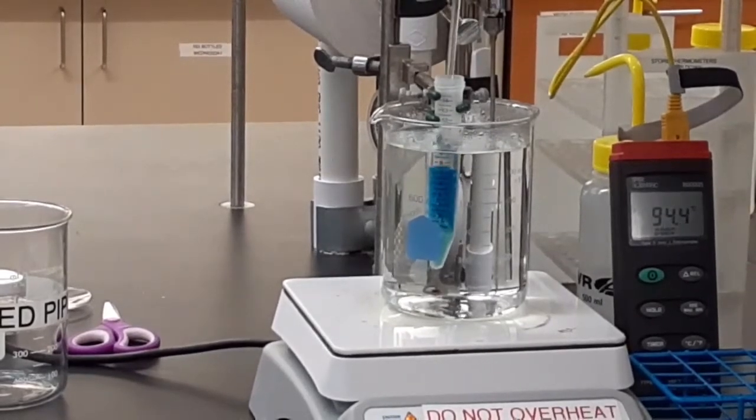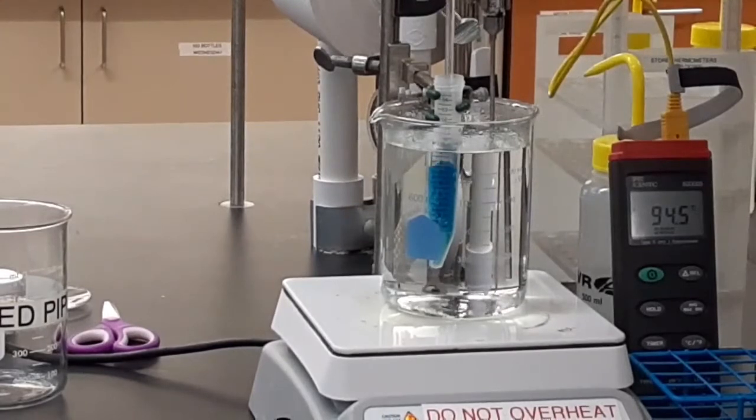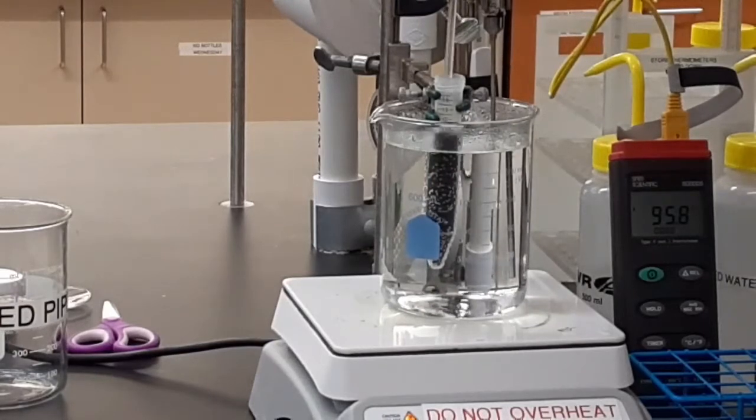Now, you're going to have a thermometer. It won't be quite like this thermometer, but you will have a way to watch the temperature. Your temperature needs to be in the mid to upper 90 degree range, 90 C. You keep stirring until your sample starts to look like that. Black copper oxide.